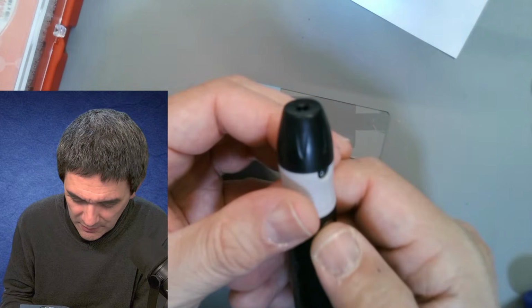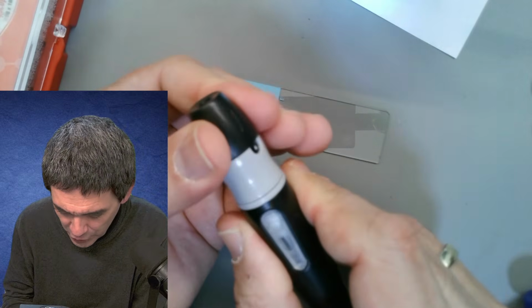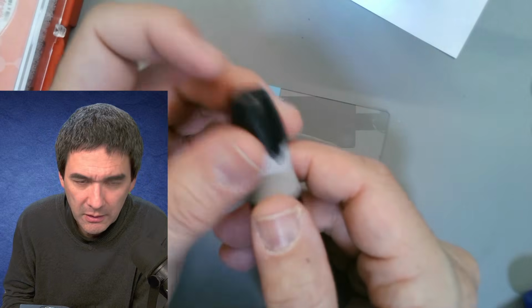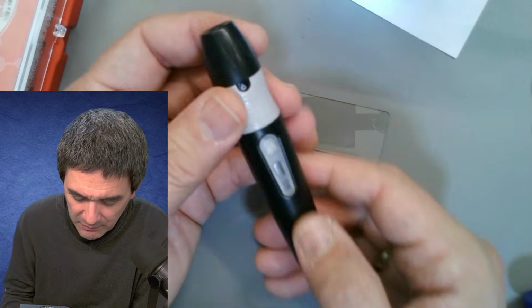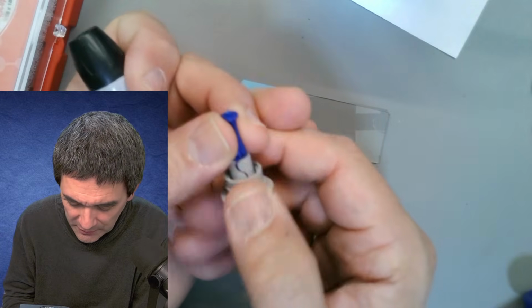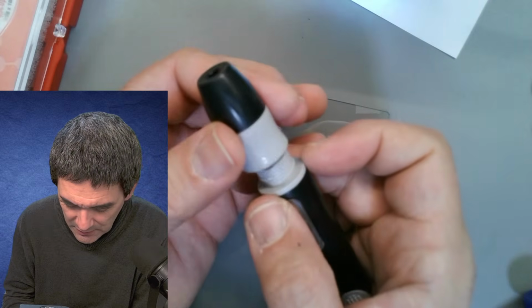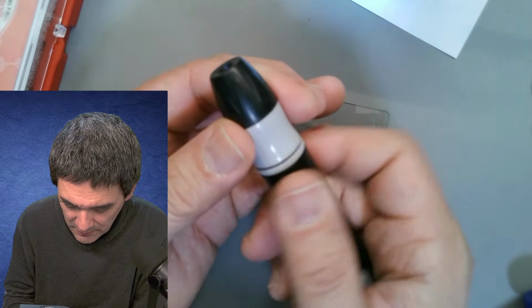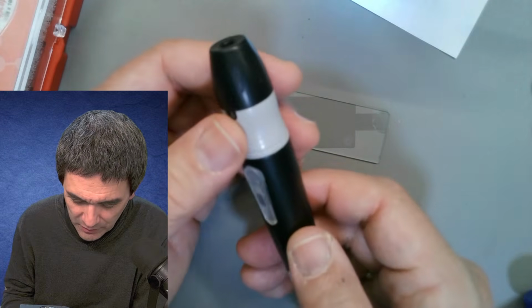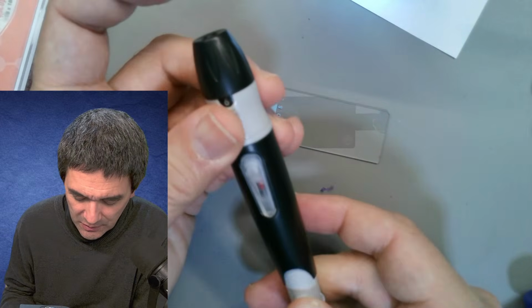Okay, and then essentially it comes out here, and here I can adjust how much. Okay, and it's actually barely coming out. Yeah, so I pull it up, and then I can basically do this because it's barely coming out. I have to push it out a little bit more. Here we go, slightly, and yeah, here it is. Yeah, so I have to charge it, pull it back, and then by pushing this here, it comes out. Yeah, and that's what I'm gonna do now.